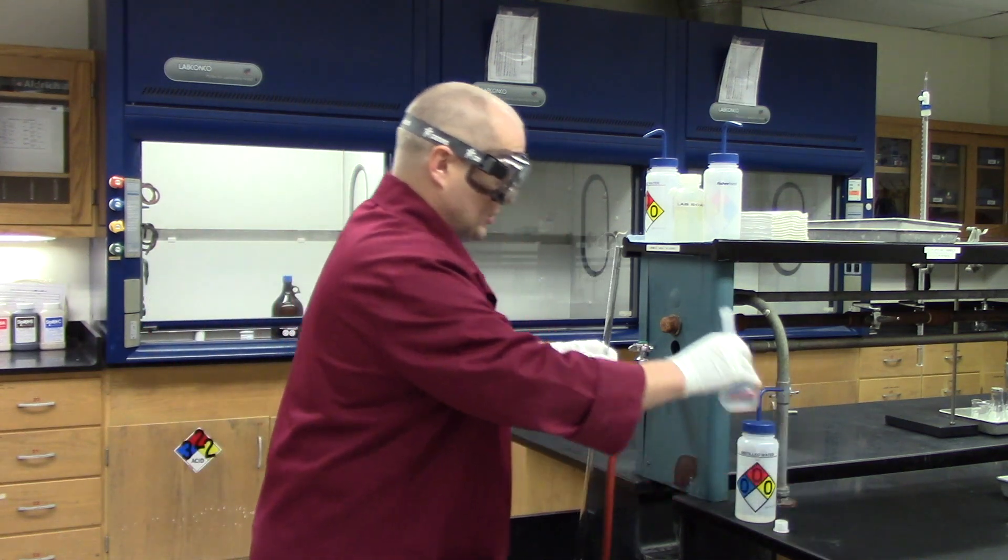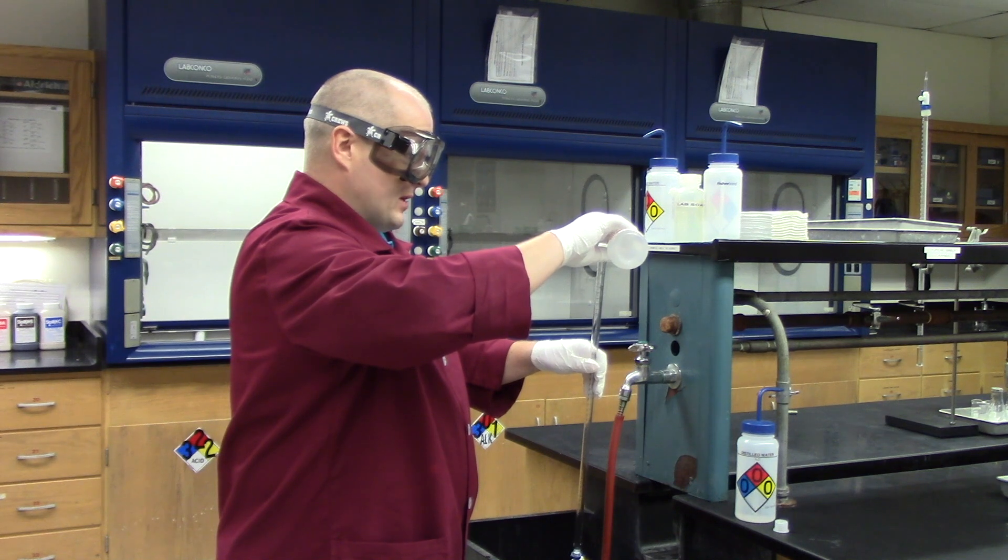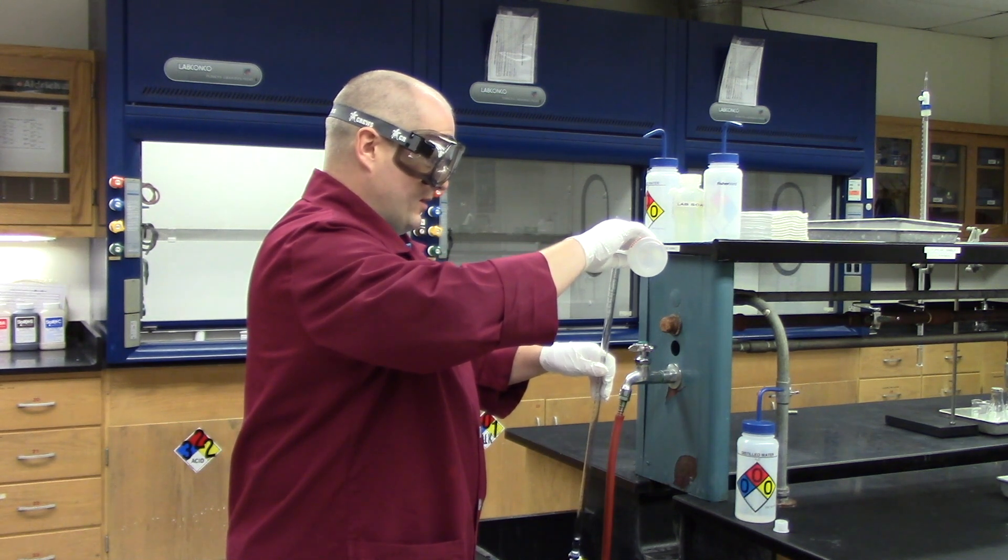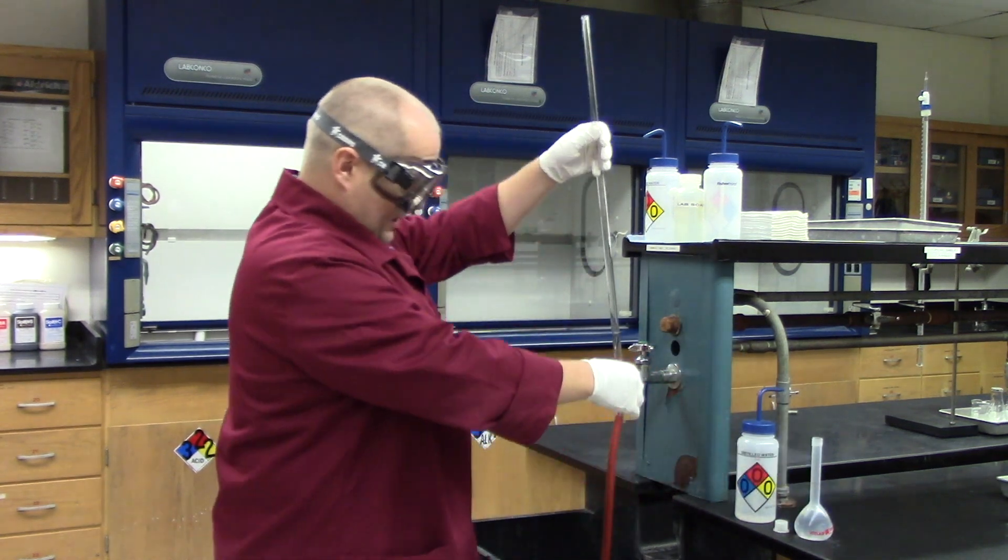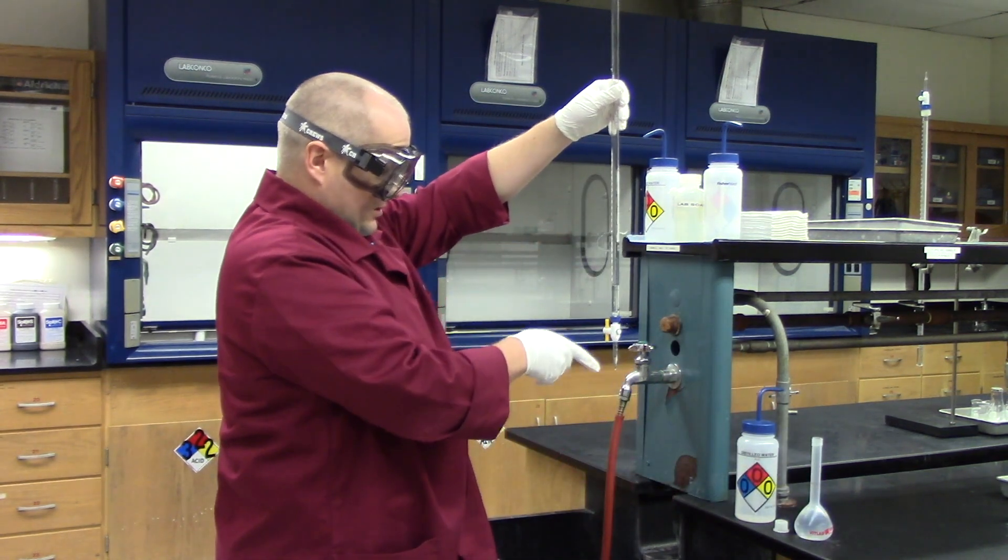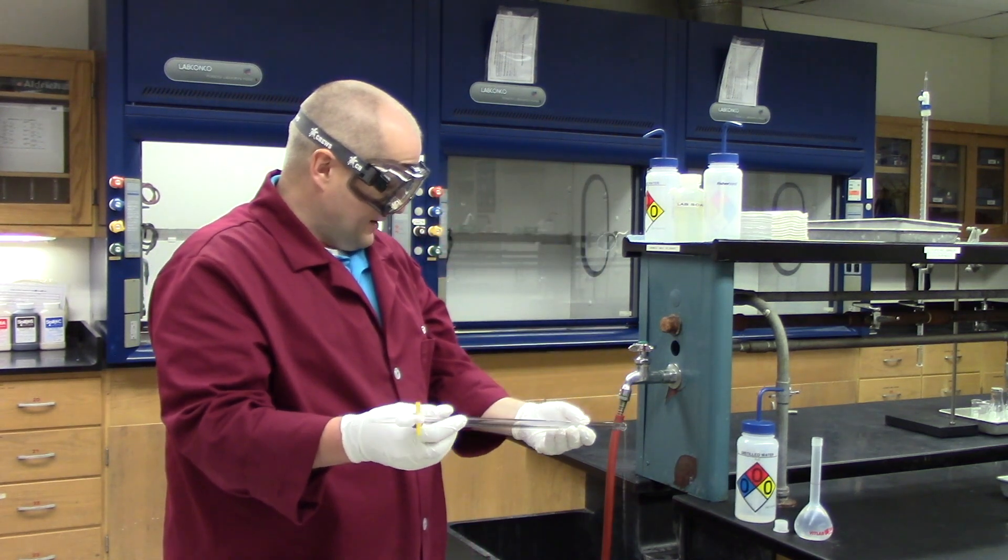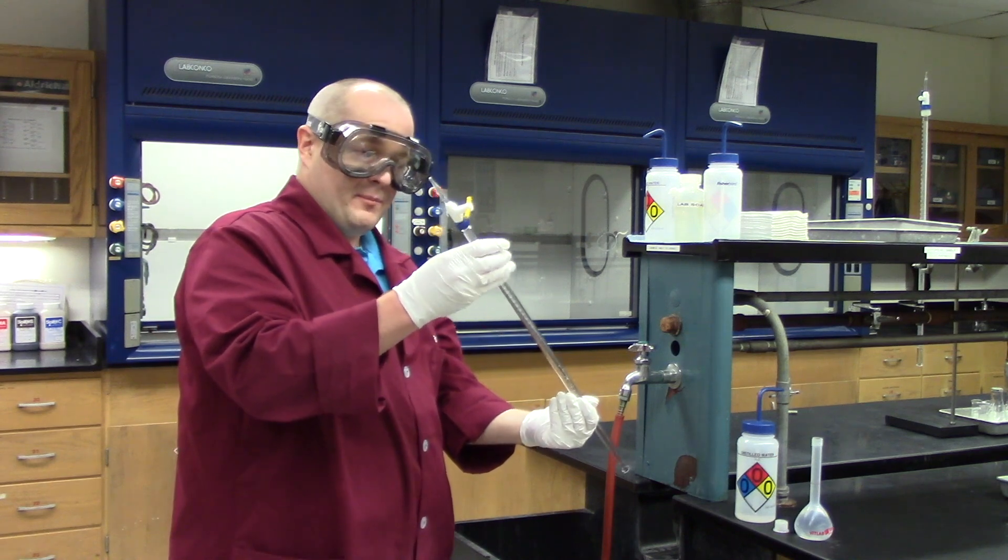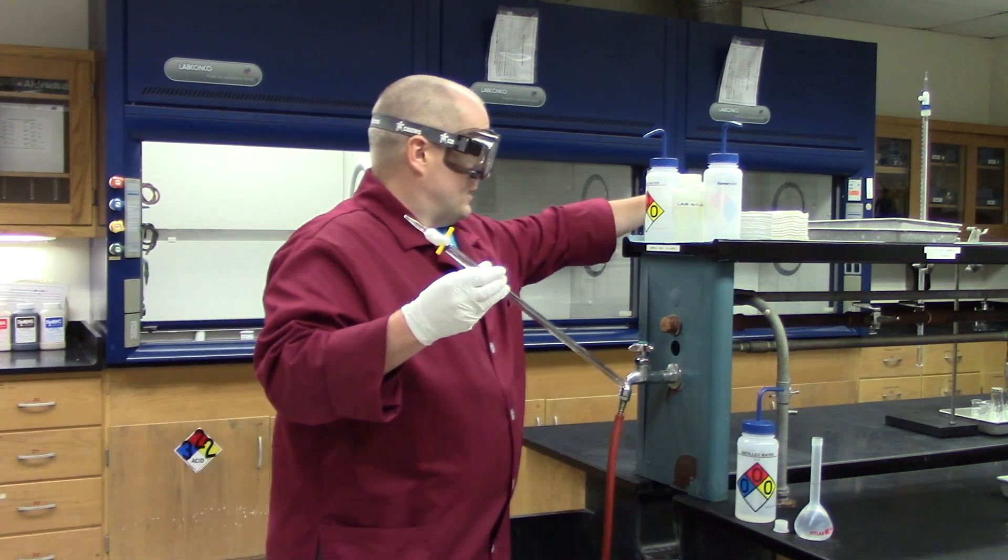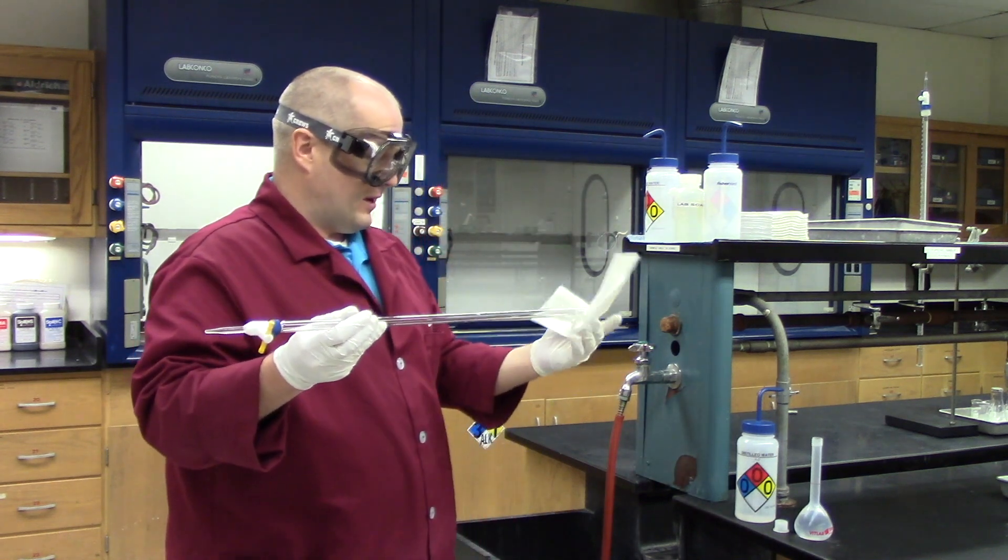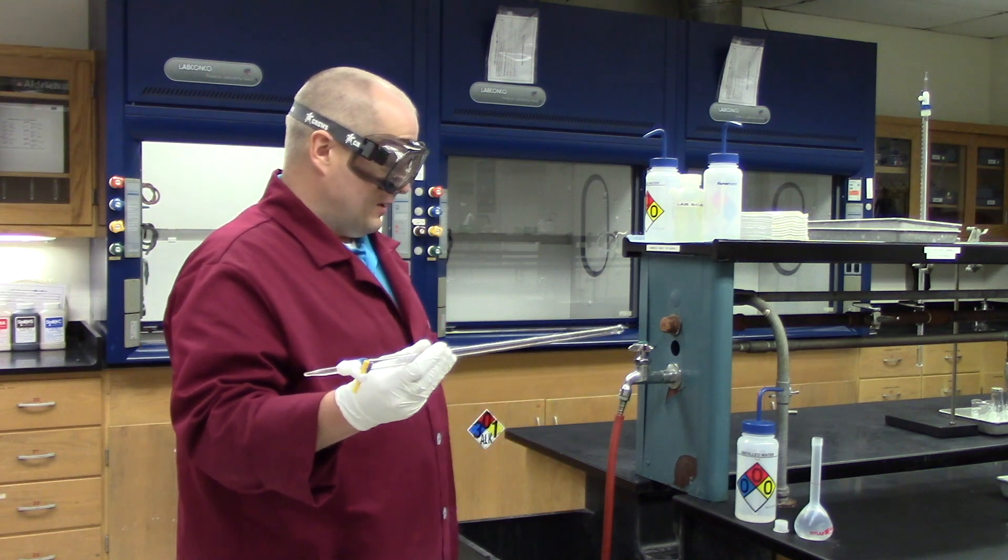Repeat that at the end just to make sure that you've got all the water out of there and the burette is now coated with your solution. Take, you know, five, ten mLs. Don't be too shy with it. Again, let some run out the bottom like so. Turn it horizontal. Let the antacid solution flow from the top. Now, we've rinsed the burette a couple of times with our desired antacid solution. We're just going to blot the top to make sure no little drops of antacid solution run down the burette.